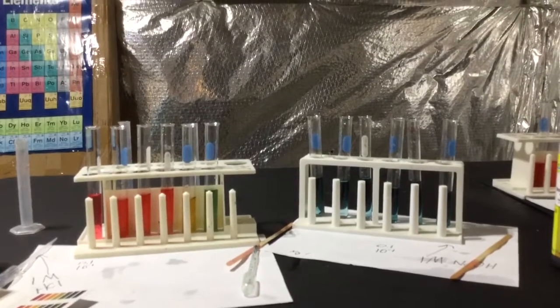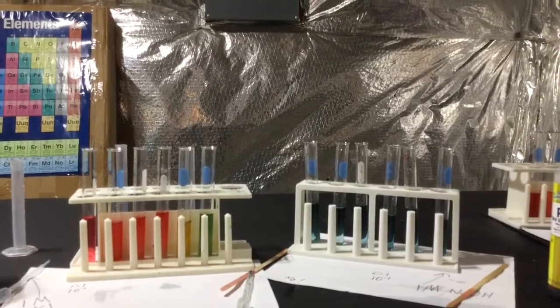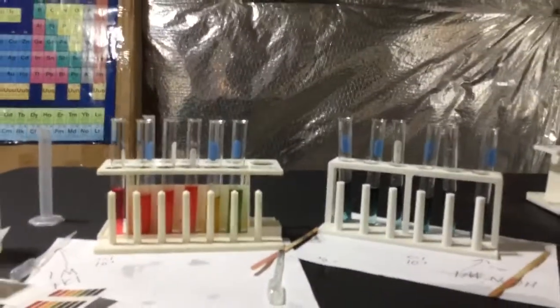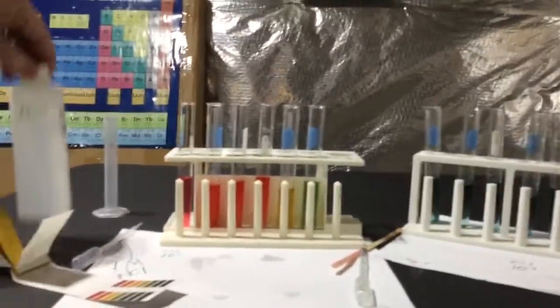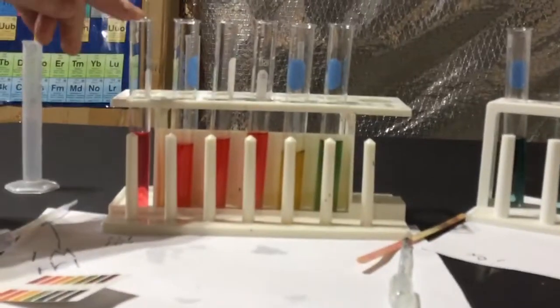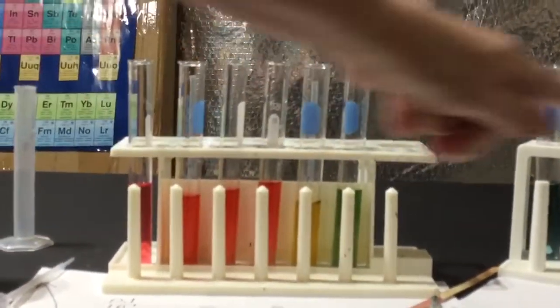So what Lacey did is she did a serial dilution with hydrochloric acid, and over here, let me just turn this around, sodium hydroxide. This is 1 molar, that's approximately 1 molar. The acids turned out a lot better. So what she did is she took exactly 1 milliliter of 1 molar and put it in 9 milliliters of water. So we had 9 milliliters in every single test tube. So let's start at the acids, okay?